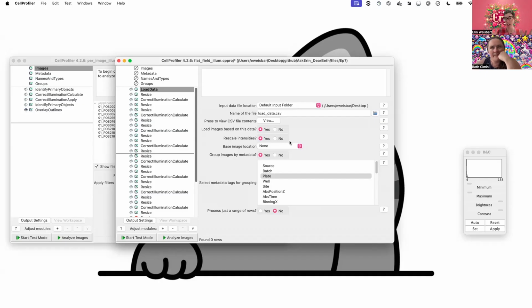So this is not good if you have slides and you are manually looking around your microscope and focusing in on, okay, look, I found the cell that I'm interested in, or I found the worm at the right stage of development, and you take a photo of that object in the middle of your image, and you're doing that manually. What this is more for is high content, where we have lots of images, and in those lots of images, there hasn't been a human moving around to decide what's in the middle of the picture. It's entirely an automated microscope that doesn't care where things are distributed.